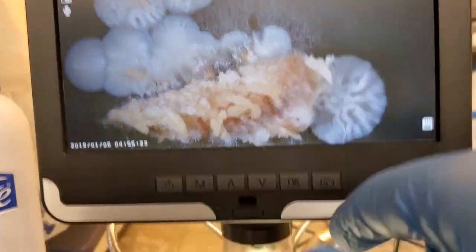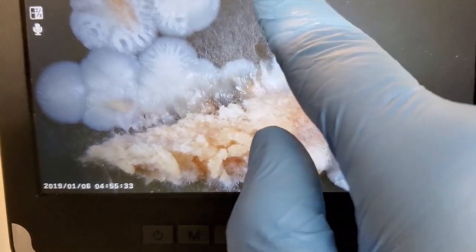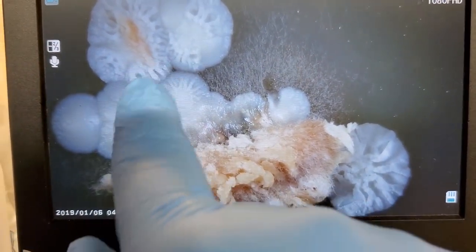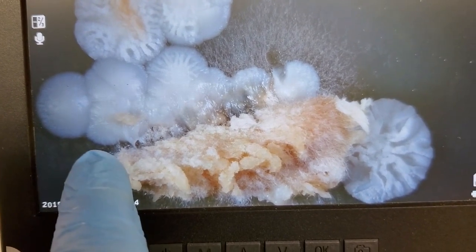Say you start with a petri dish of this size, and let's say that we take our chunk, put it here where this guy is, and it starts radiating outwards, say in an area like that, but over on this side, say we get a little bit of this. All it takes is one or two of these guys to hitch a ride, and we get one of these growths over on this side.